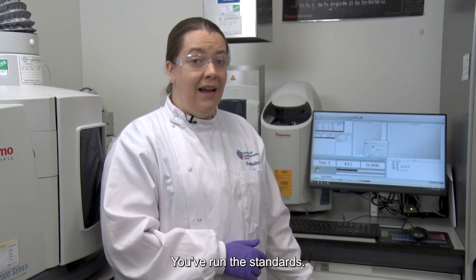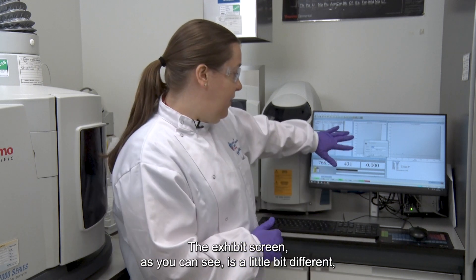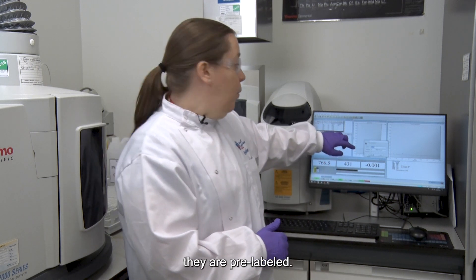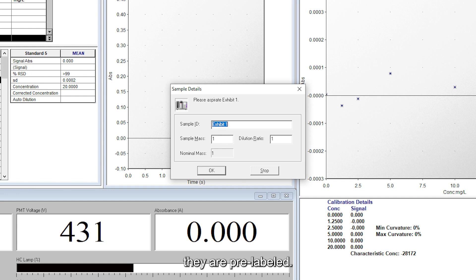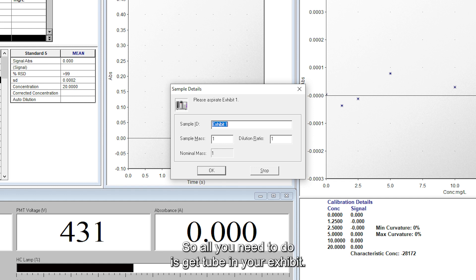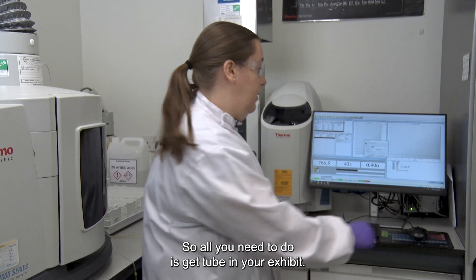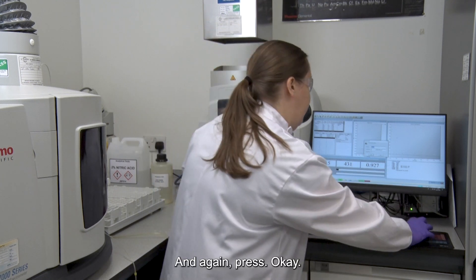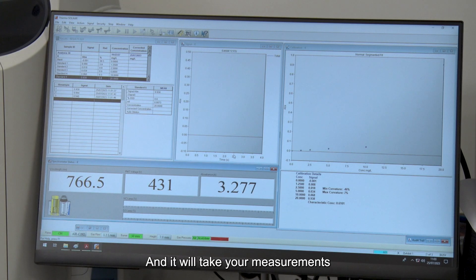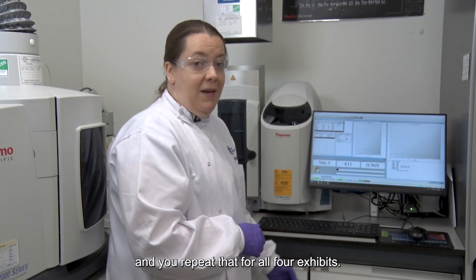You've run the standards, now it's time to run your exhibits. The exhibit screen, as you can see, is a little bit different. They're pre-labeled, so all you need to do is get the tube in your exhibit and press OK, and it will take your measurements. Repeat that for all four exhibits.